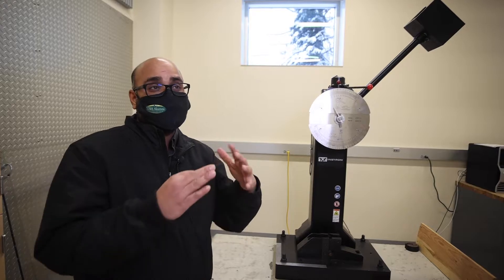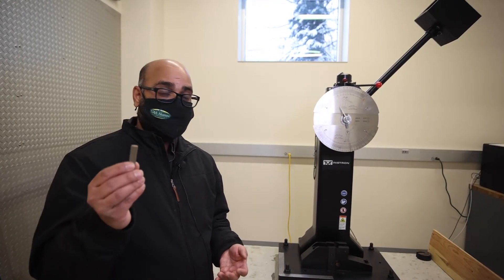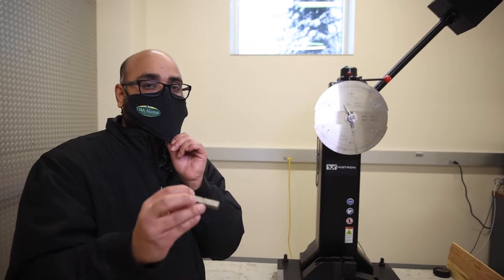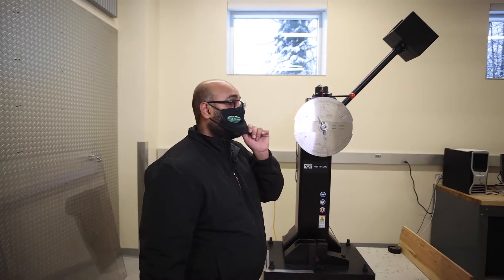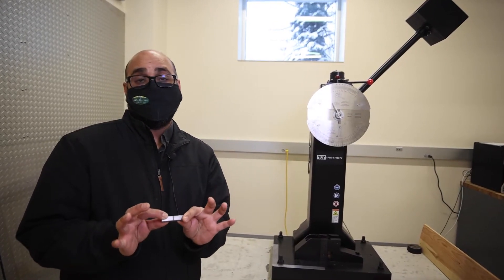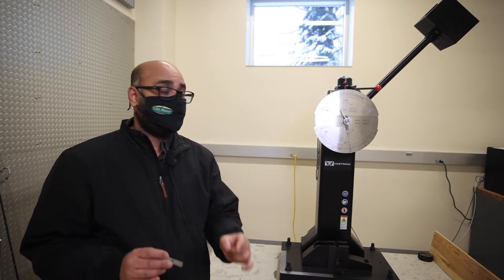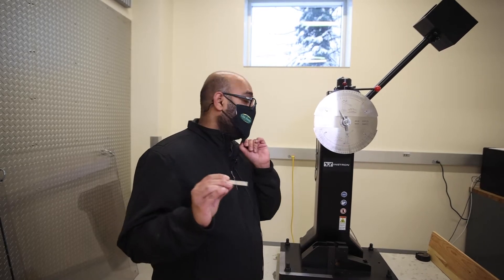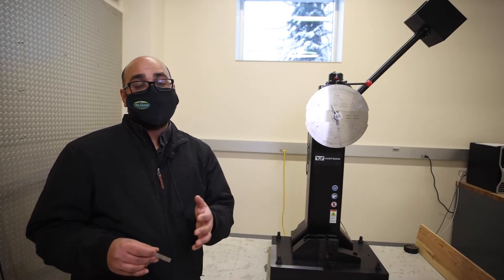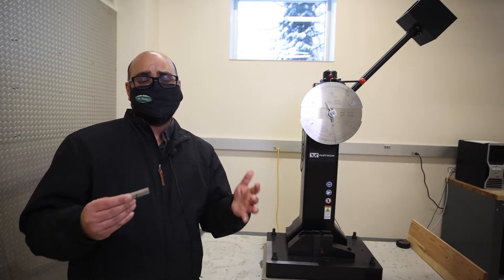When you have a ductile sample that goes through a lot of plastic deformation before breaking, it's going to absorb a lot of energy. We can take another sample of the same alloy, put a notch in it, place it in an ice bath to lower the temperature, then quickly put it in the slot, re-zero it, and release the hammer. The sample will break, but now in a brittle manner. Since it's brittle at cold temperature — almost like the chalk or glass — it won't take much energy to break. We can then plot energy absorbed as a function of temperature to understand how materials behave at different temperatures.